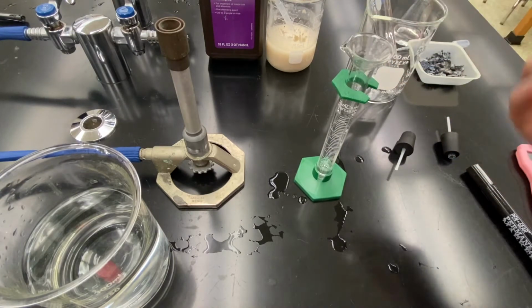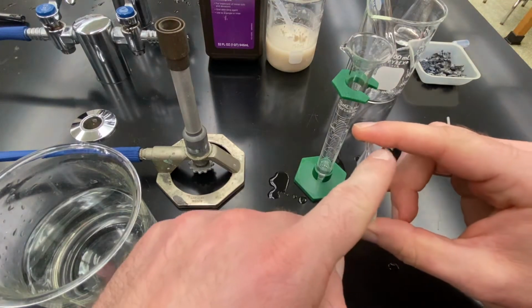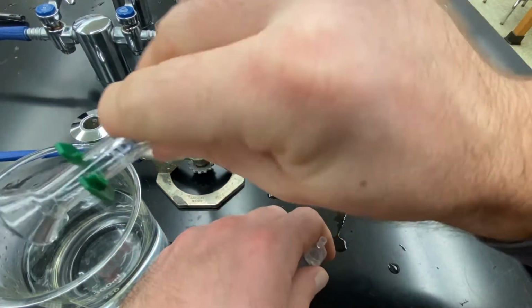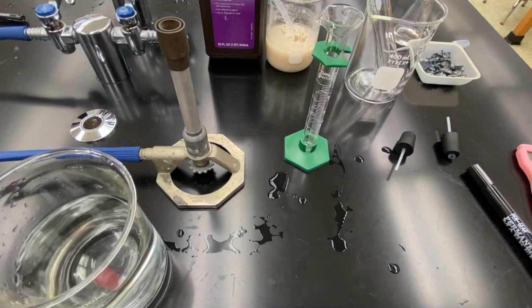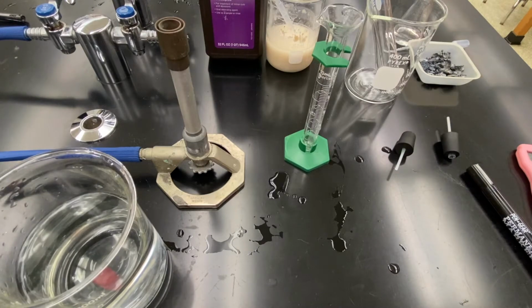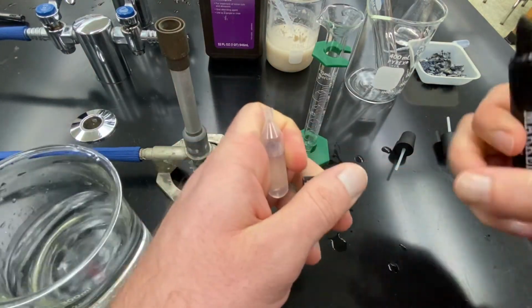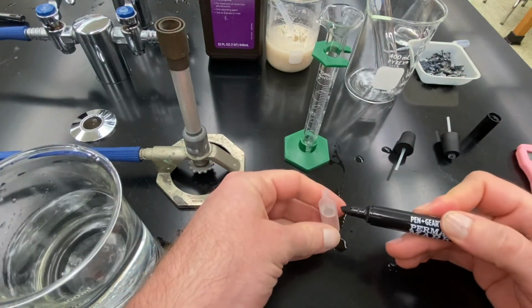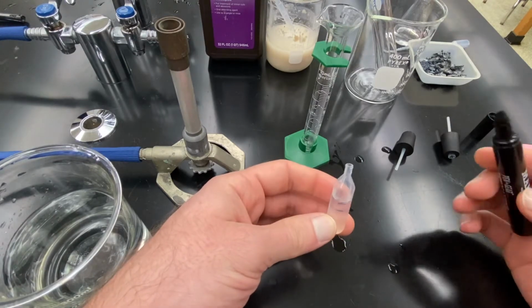And I'm right there. And so now I could put a mark on this pipette right where the 1/3 mark is. And so I'm going to dump this out. I'm going to dry the outside of my pipette bulb so the marker actually can write on it. And then I'm going to take my marker and I'm going to mark the 1/3. So that is the 1/3 mark.